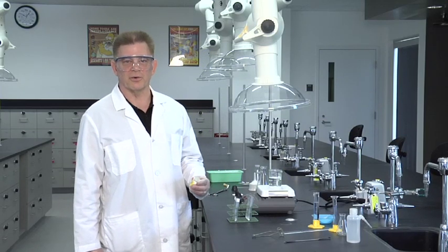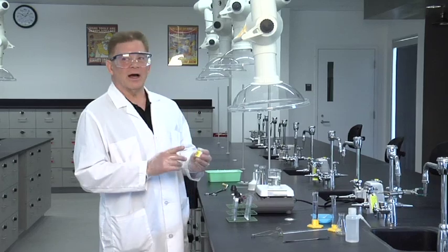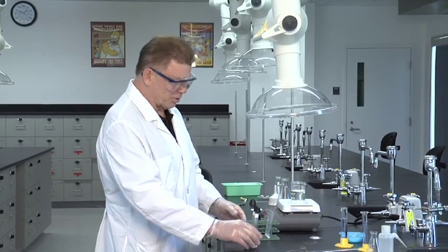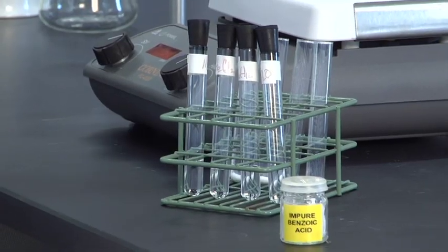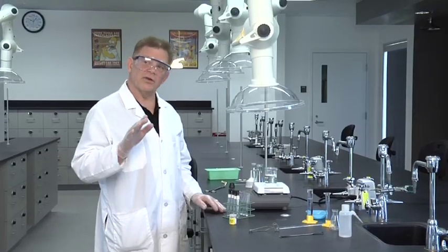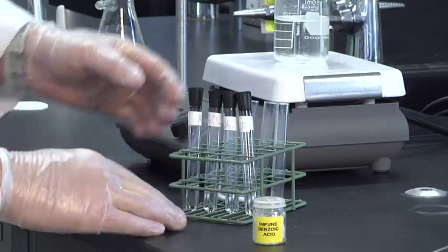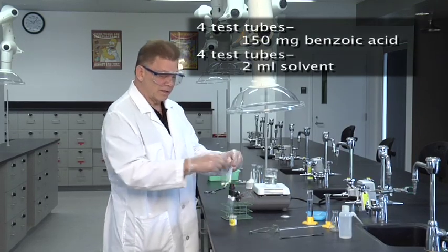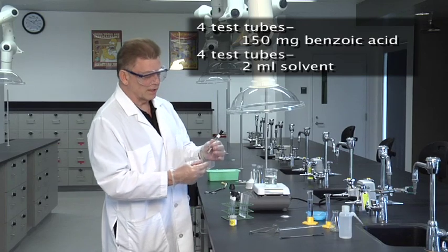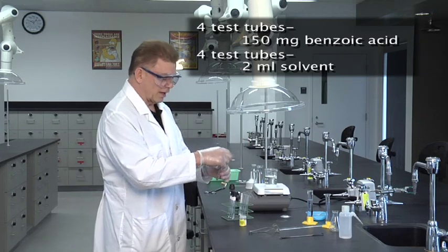In this little experiment, we're going to recrystallize some benzoic acid. Our stockroom has prepared a bottle of impure benzoic acid. I'm going to use this as a model compound to demonstrate how you would select an appropriate solvent for recrystallization. I've picked four solvents and we're just going to try these out. I've prepared four test tubes with 150 milligrams of benzoic acid and four test tubes with two milliliters of a particular solvent, and we'll just go and see what happens.